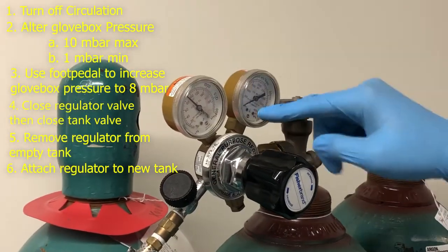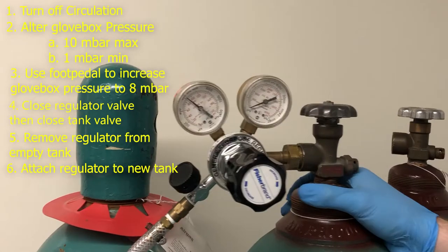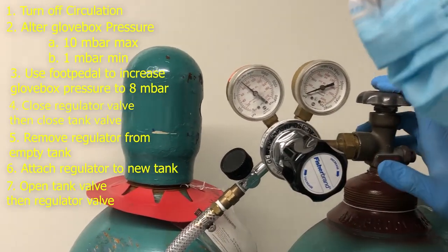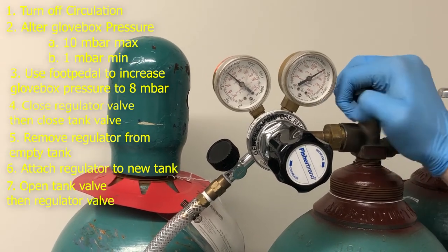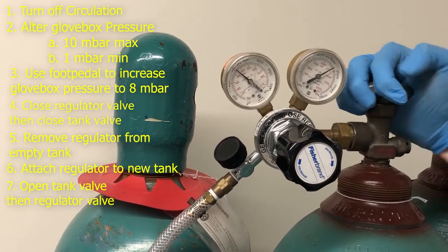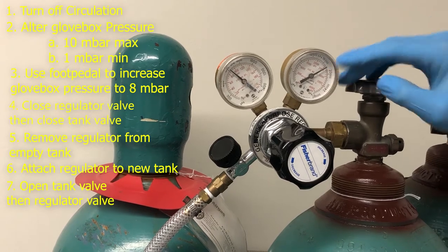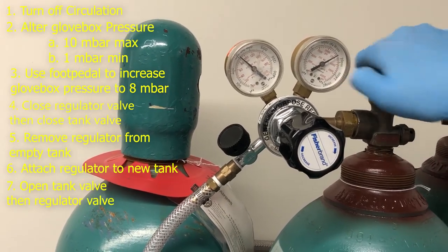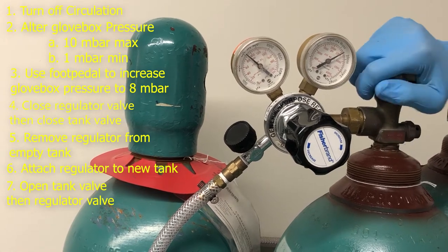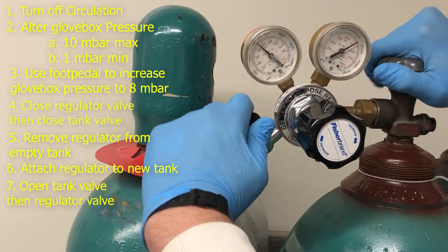Alright. And that's easy for us to read that. So then you're going to open this in the opposite order. The way we closed it, now we're going to open it the other way. First we're going to open this tank. Great. It should be around 2500 psi. That red mark you can see is at 2500. So that's perfect. Open this all the way. And open this one all the way after.